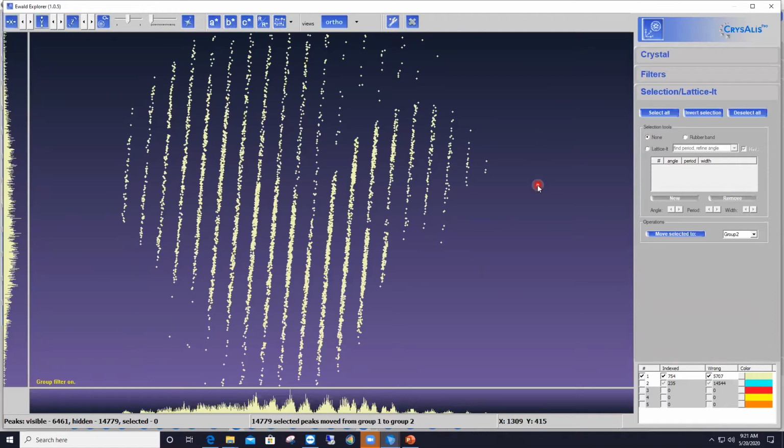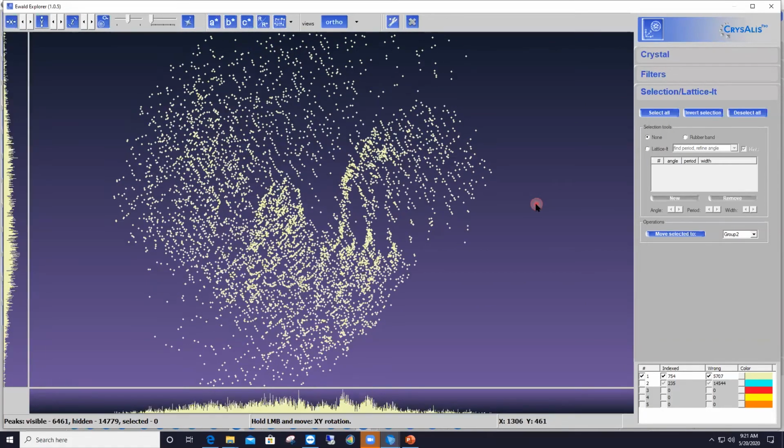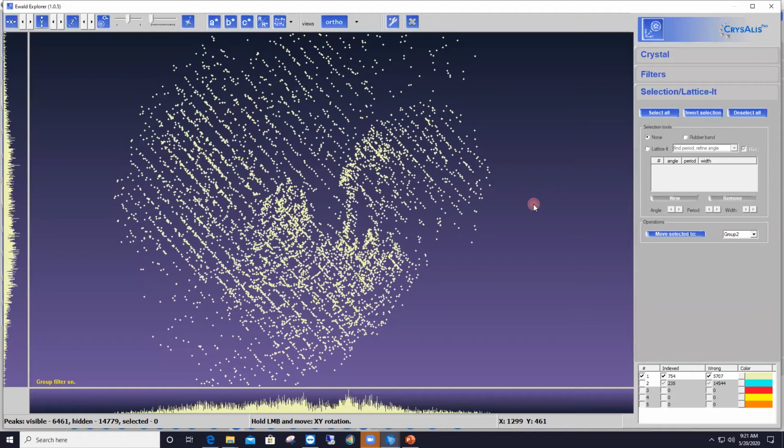So now I'm going to rotate that diffraction pattern again to try to find another orientation where I see another set of rows. So here I choose again any direction I wish, and I rotate the diffraction pattern a little bit in the horizontal direction until I find this other set of rows. And then again, I can see that there is a set of rows with lots of reflections in between them. So this is another good orientation to apply Lattice-It to and clean up some more rogue reflections here, those that are placed in between the rows of reflections.